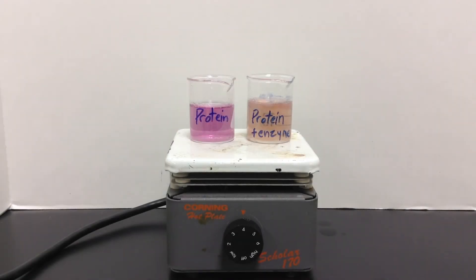You can see by the difference in color that the enzymes have been digesting the proteins in the beaker on the right.